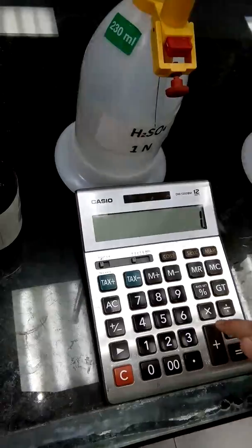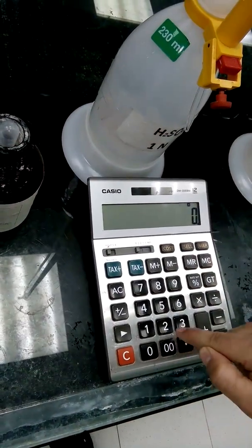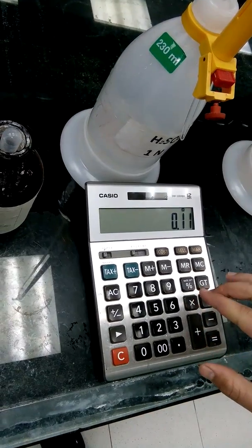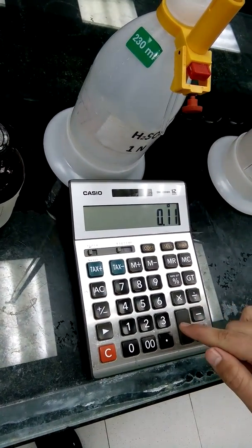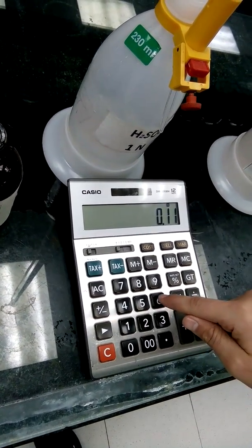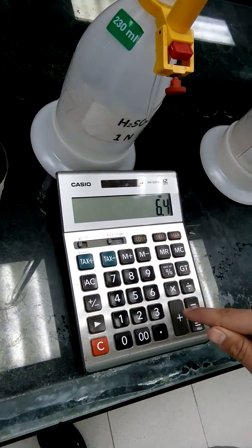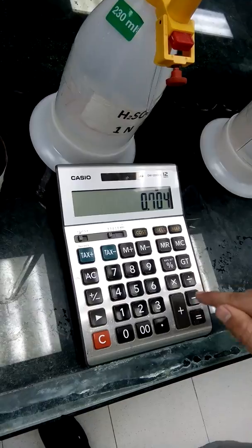This is the amount of NaOH and its normality, and the organic acid equivalent weight, which is 64 divided by 10 equals 6.4.